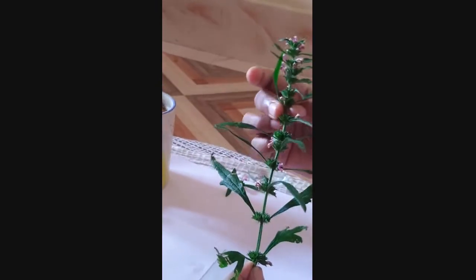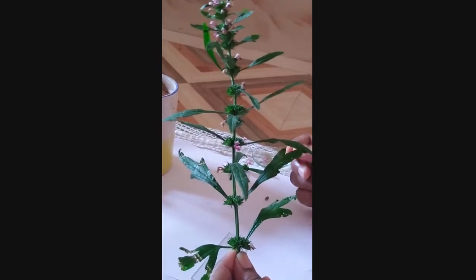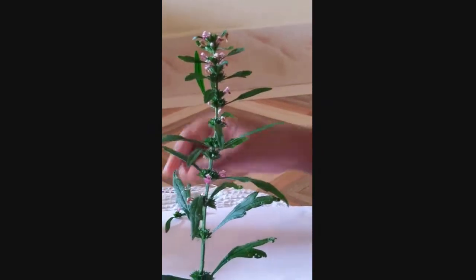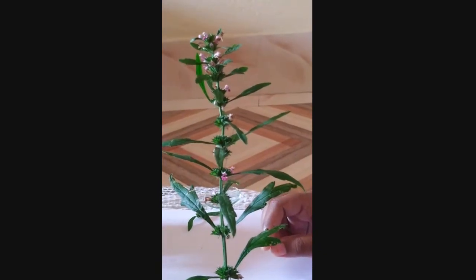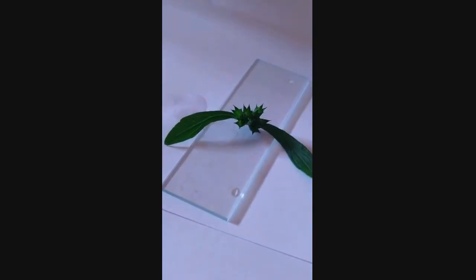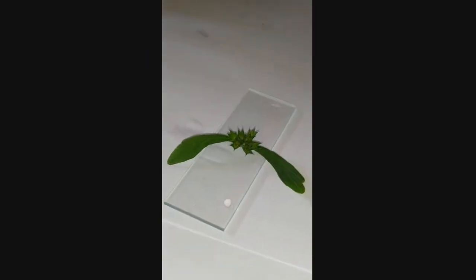Next, the inflorescence of Leonurus or Labiati family. The inflorescence type is verticillaster. You can see that the inflorescence is verticillaster type — that is, all the flowers arranged in a false whorl around the stem. If we cut down one single inflorescence, we can see this verticillaster type, which is the actual arrangement of flowers in a false whorl.